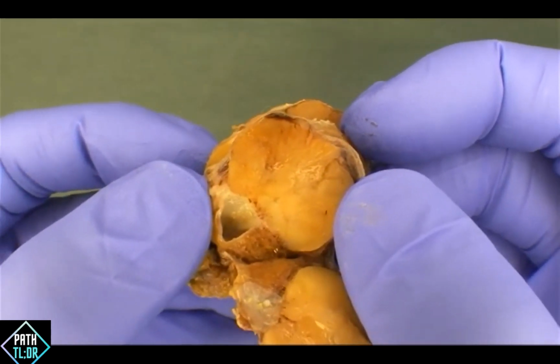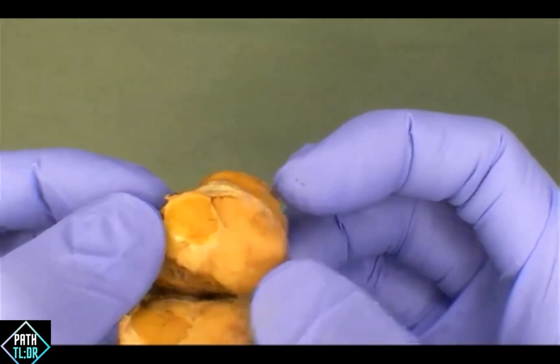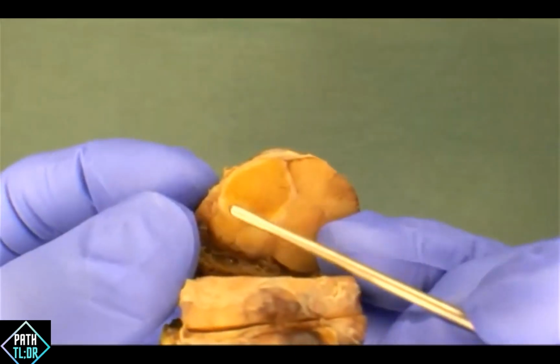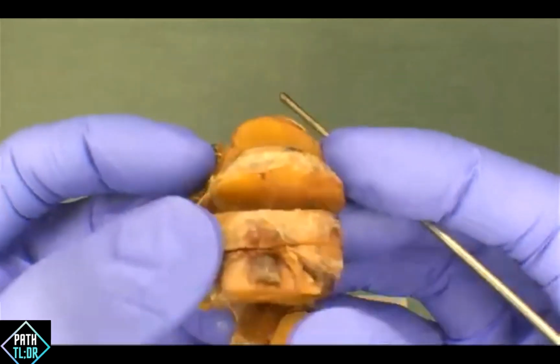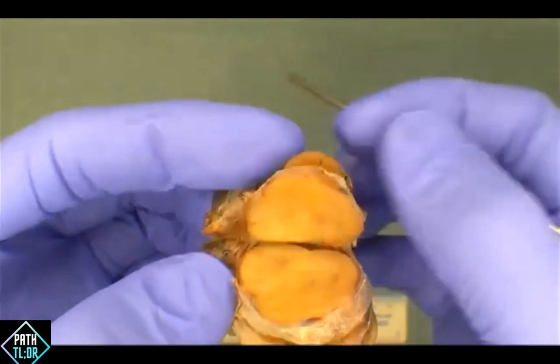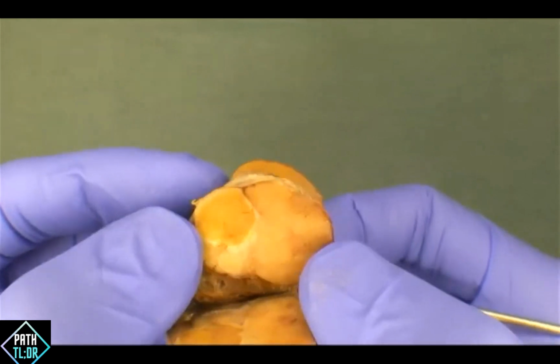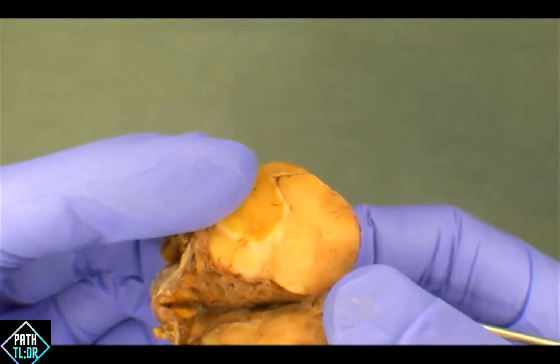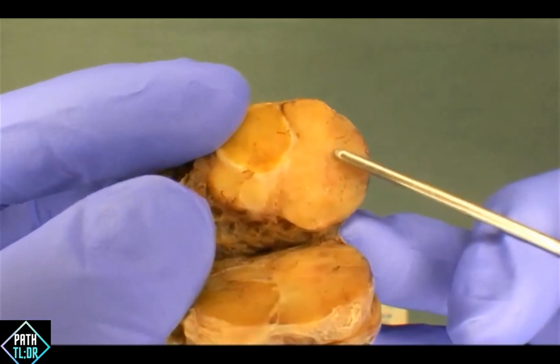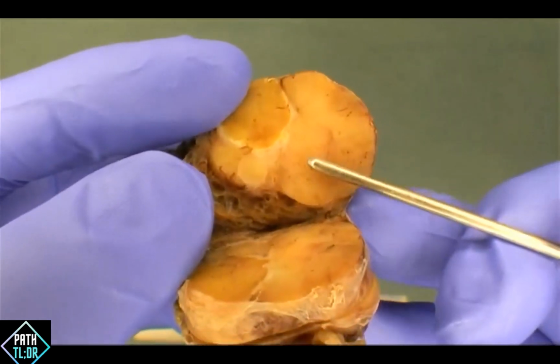Yeah, so I think this is tricky. Sometimes it's actually really difficult to grossly appreciate encapsulation of nodules. If I had to, I might suggest that this nodule here might have a capsule, but it's hard to tell sometimes. It's rather difficult. Okay. So yeah, one of the key descriptors that I would use for this, and again, I think maybe it's just the color coming through the camera, is I'd probably use the word fleshy for this one as well, and more on this slice. And I recognize the camera's probably making this a little bit darker than it is, but this is definitely very fleshy.